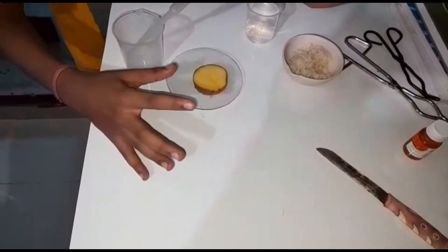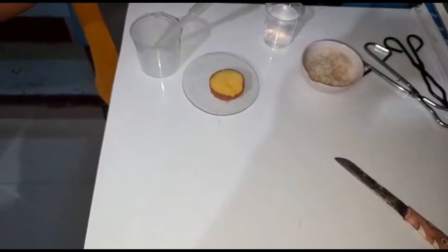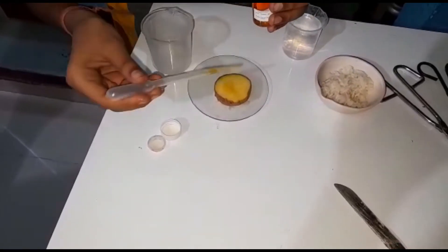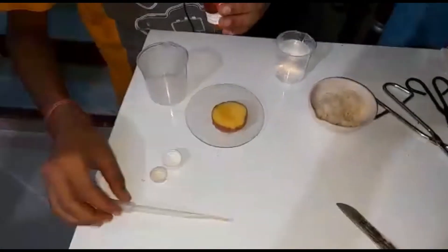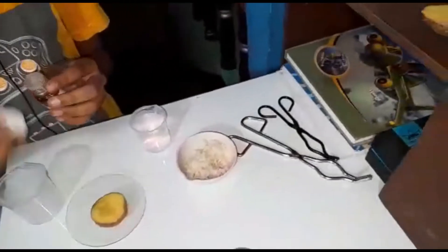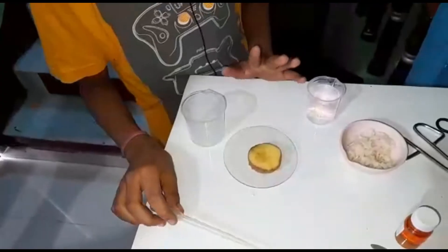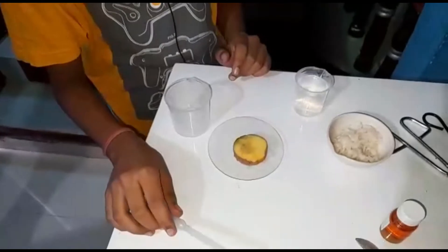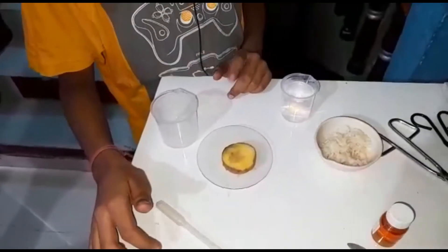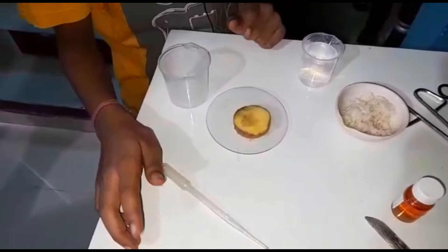Here I am going to put a potato and iodine solution. After adding iodine, the color is black or blue.